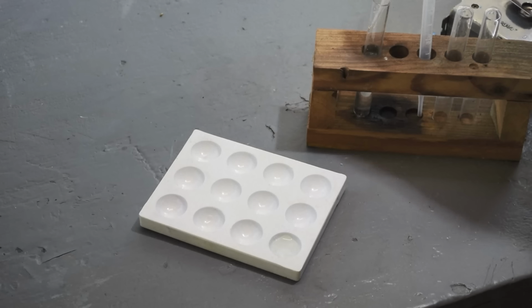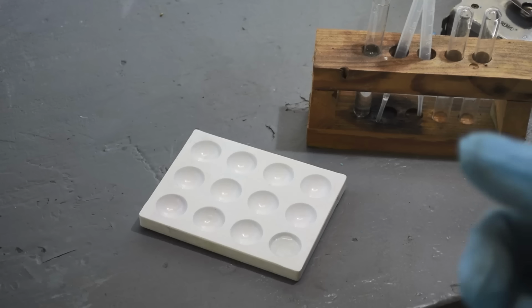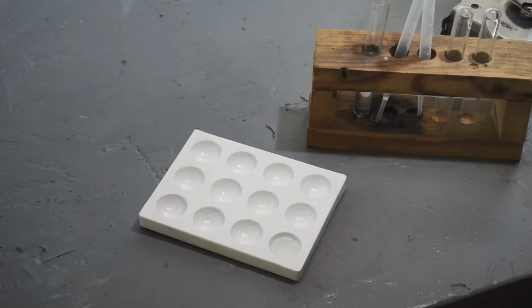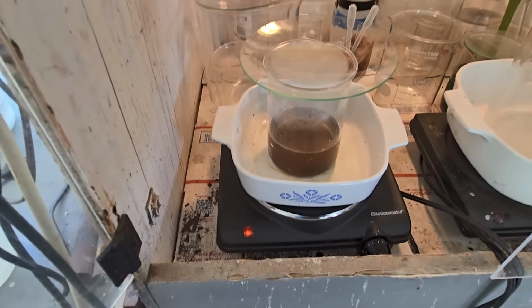Nothing. We got a whole lot of nothing going on there. So we got all the gold out of solution. It's on the bottom of the beaker. Excellent. So what I'm going to do is get the beaker out very carefully because it's very full, and I'm going to siphon that liquid into Yanni's stock pot, and then we'll start cleaning up the gold so we can get the remains of the liquid out of it that we precipitated it from, get it consolidated hopefully with some boils, and then dry it out and weigh it and see how much gold we got. Alrighty, if you've watched my videos, you know what I do next.